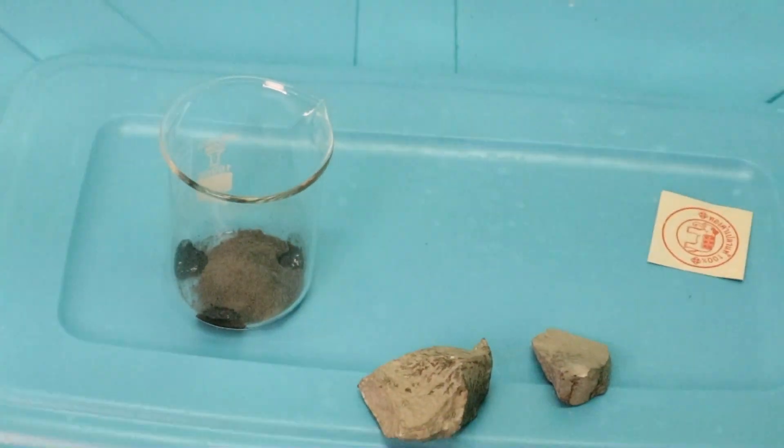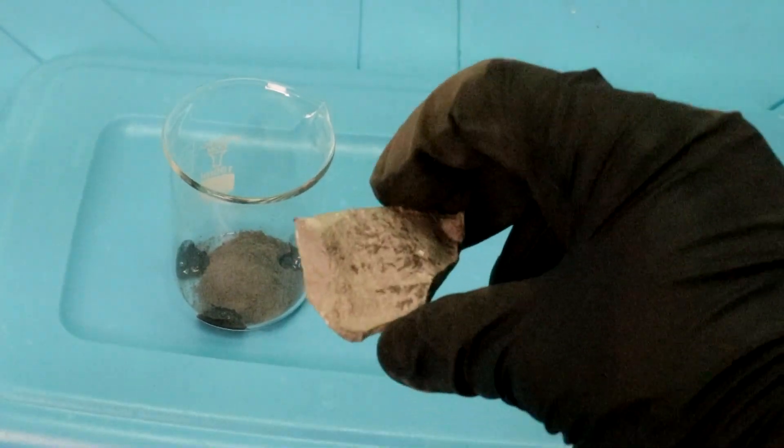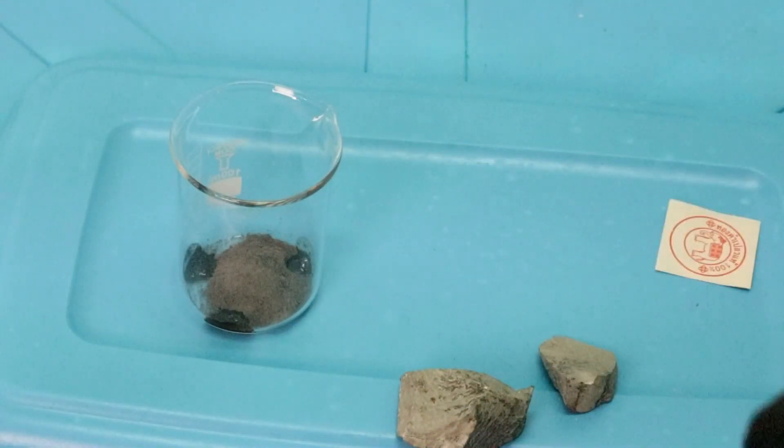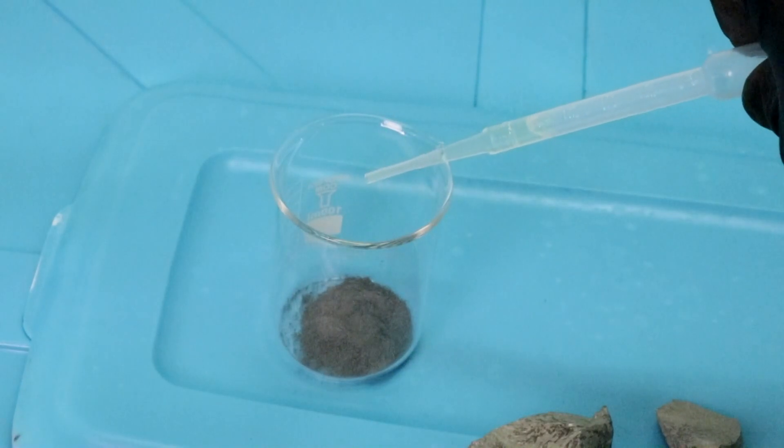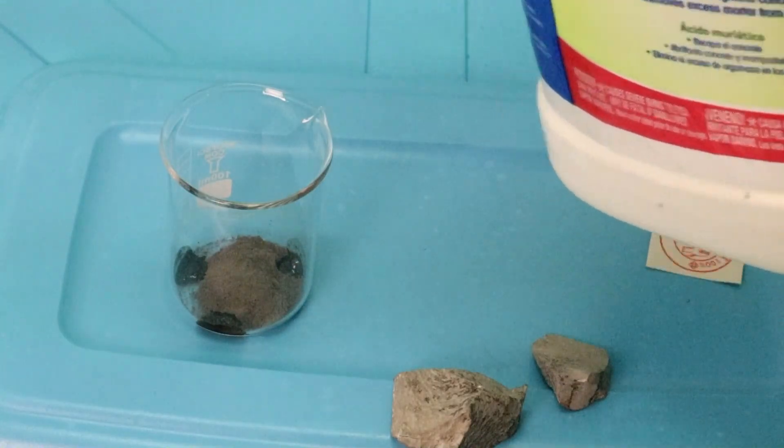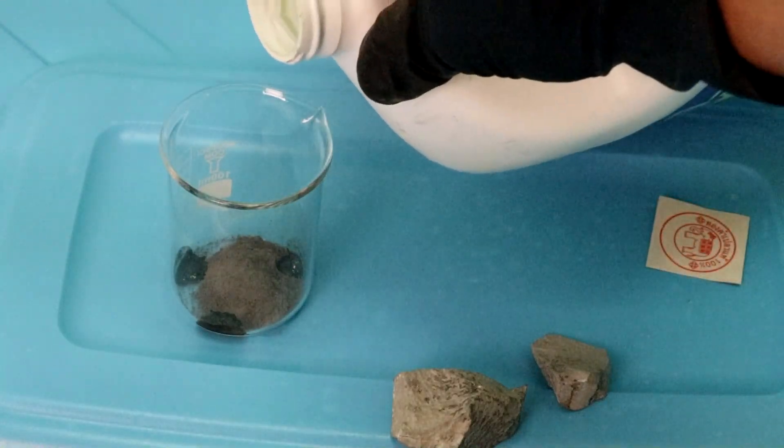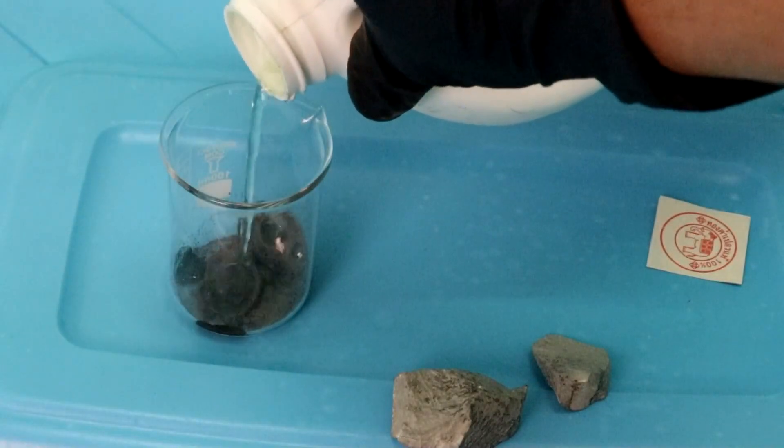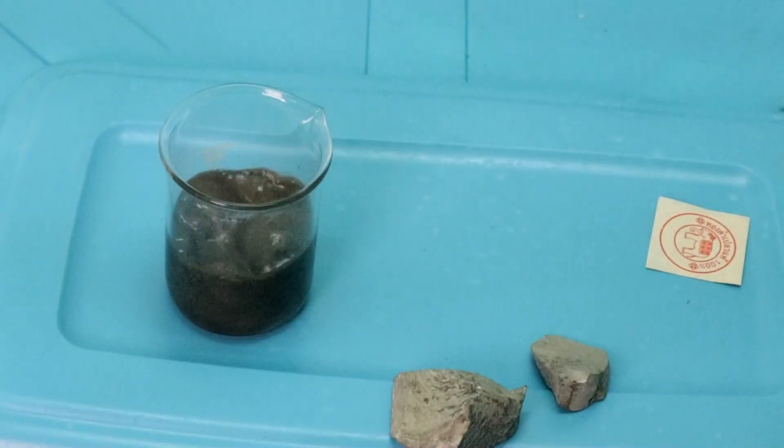The reason for that is the high level of calcium carbonate in this rock. So you don't want to put your expensive nitric acid in there. Also, having all the calcium and iron dissolved makes it more difficult to recover the gold later. So what do you do? You take your cheaper muriatic acid, or hydrochloric acid, and dump a bunch in to dissolve away the calcium, iron, and other things that might be there.